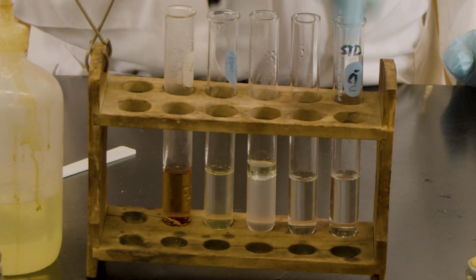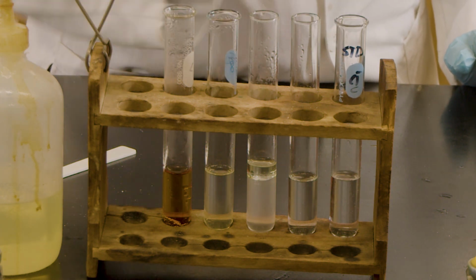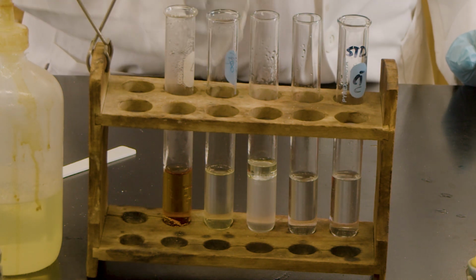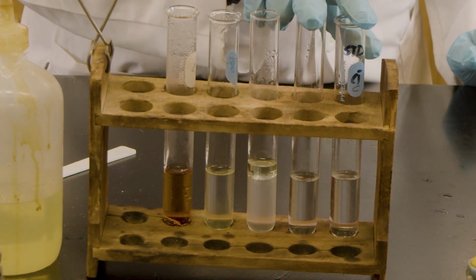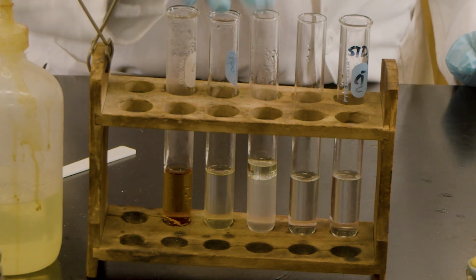So sodium chloride dissolves in the cold water. I did not do any hot bath, but even if you do the hot bath, it is still soluble. Okay, so this is for sodium chloride and water. This is for sucrose and water. Both of them are soluble in cold water. If you do the hot bath, they are still soluble.